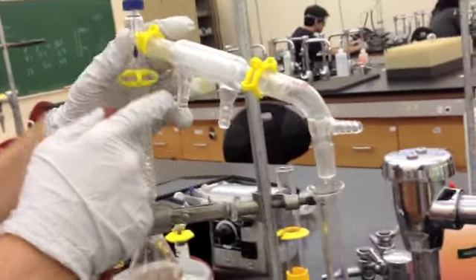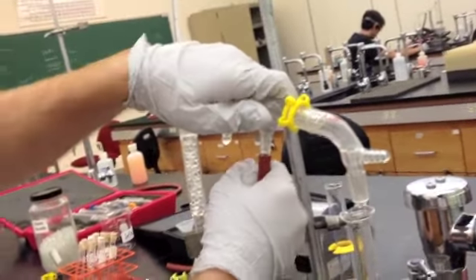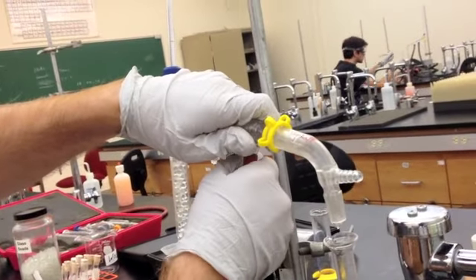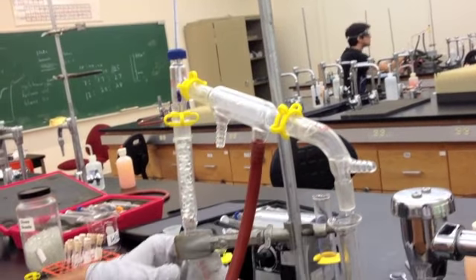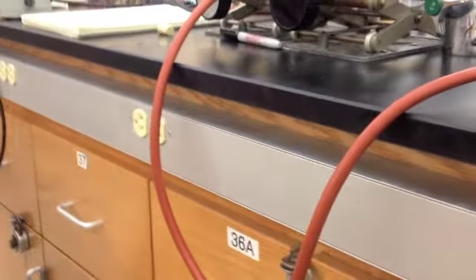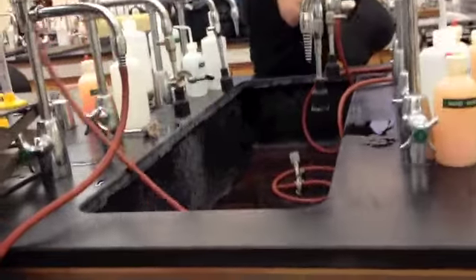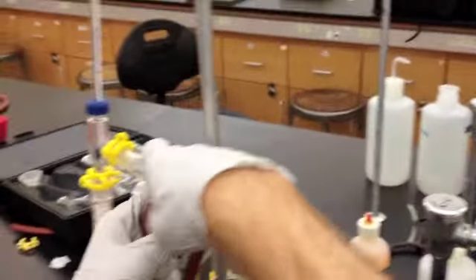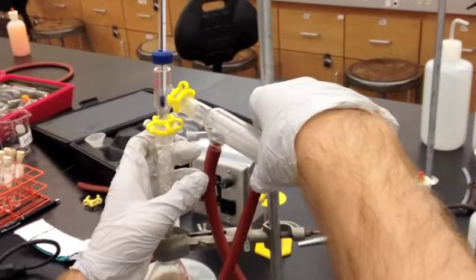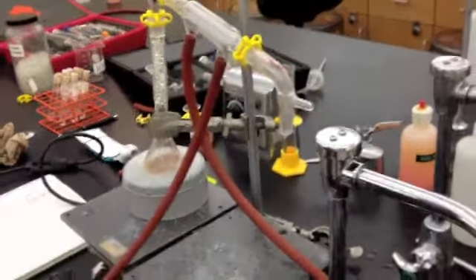At this point, I will raise my jack all the way. Now, this end goes out to the sink, but it's connected to the upper section of the water condenser.